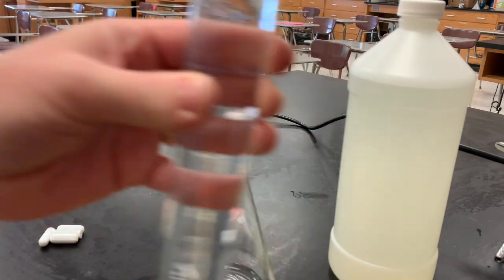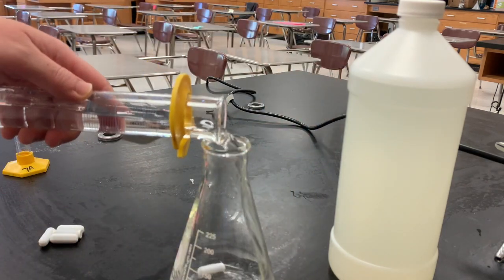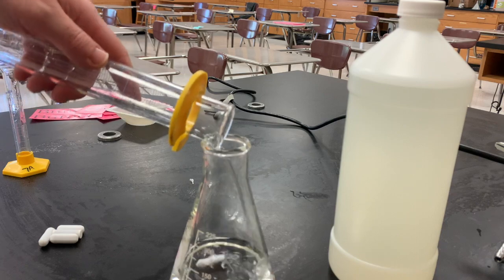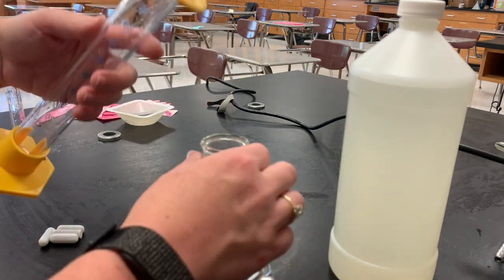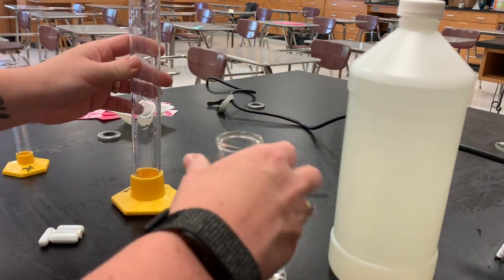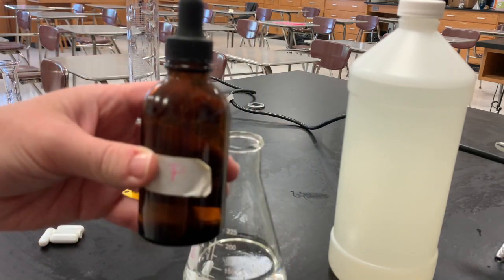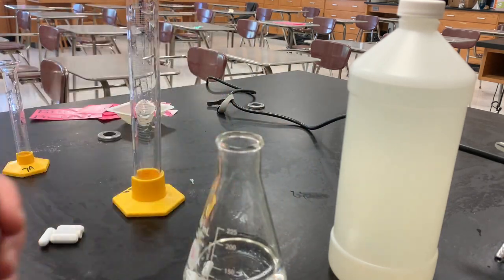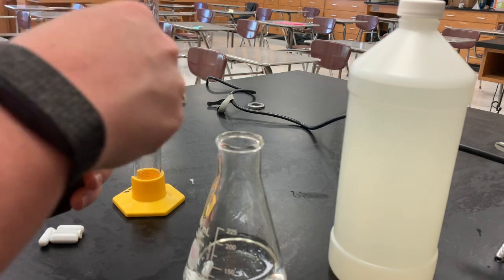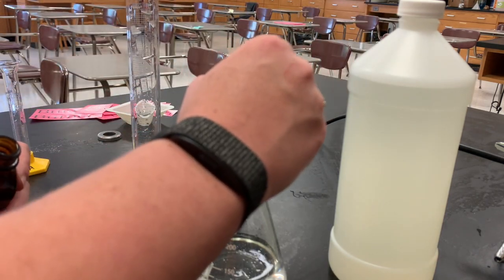This is 100 mL of deionized water. I'm going to give that just a little swirl to get it mixed together. Then I'm going to add in some phenolphthalein — this was labeled with 'P' because we bought a big bottle and separated it. Phenolphthalein is an acid-base indicator.